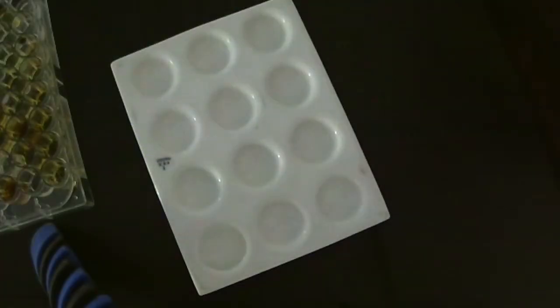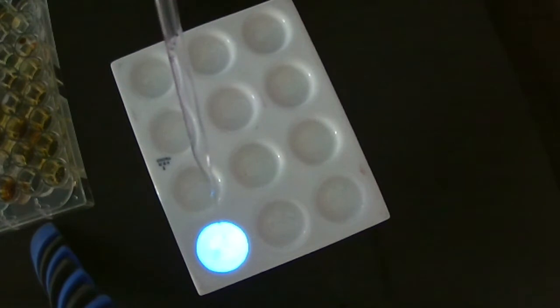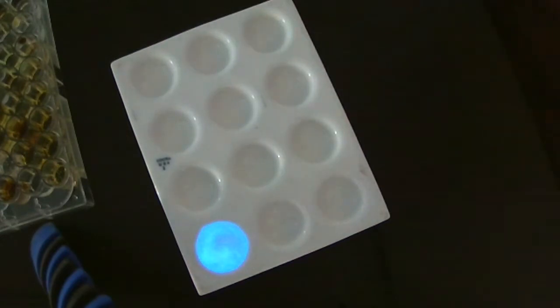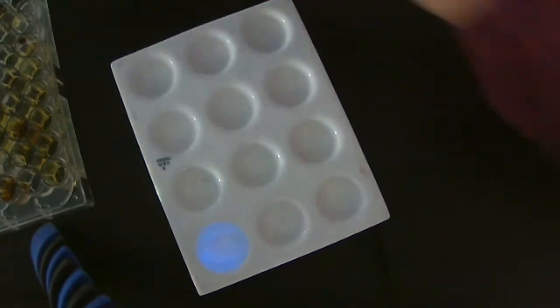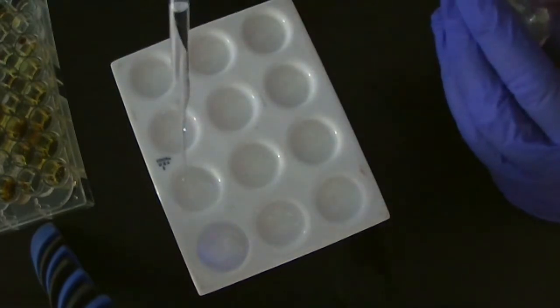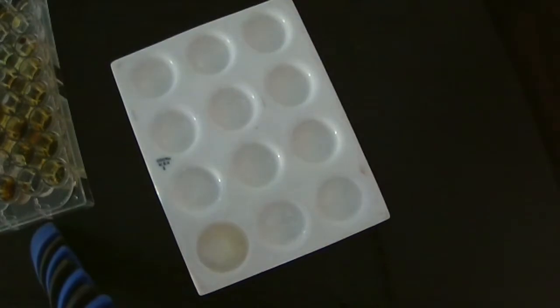Next, we started testing the proportions of the reagents. And again, different sets of students were using different sets of reagents, so it wasn't necessarily building on whoever called in a set of reagents before. But anyone could throw out a recipe, so to speak, and I would test it for them.